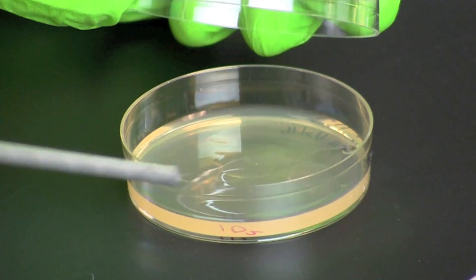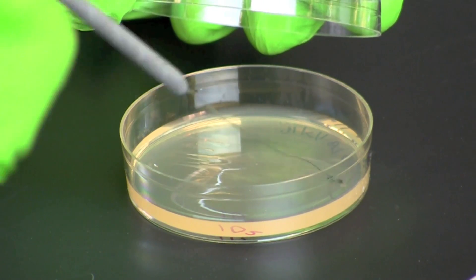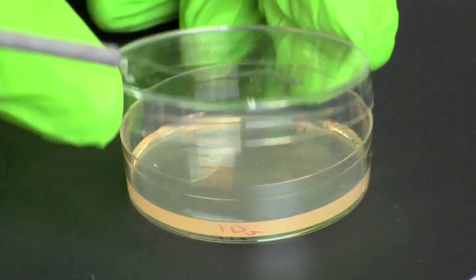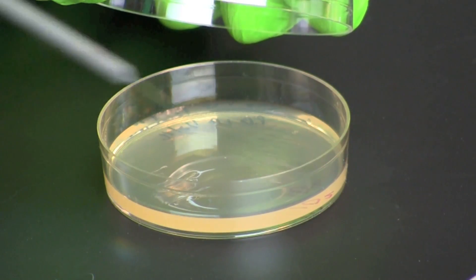Very gently spread the bacterial culture over the entire surface in all directions, including the edge of the plate. Do not use the streak plate technique because you are not isolating for single colonies.